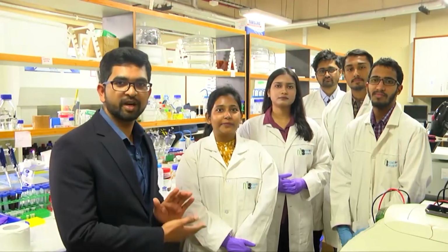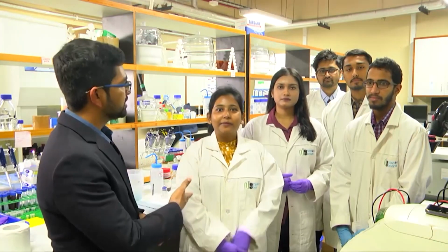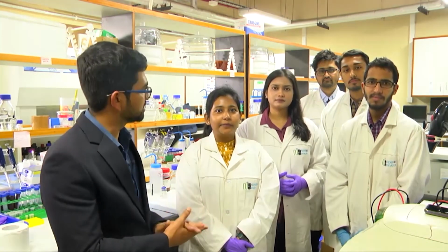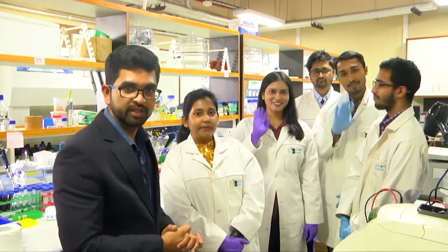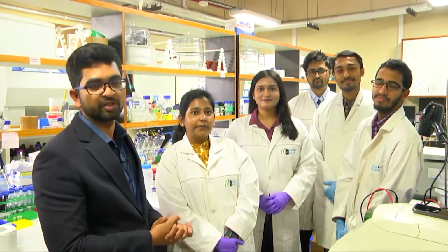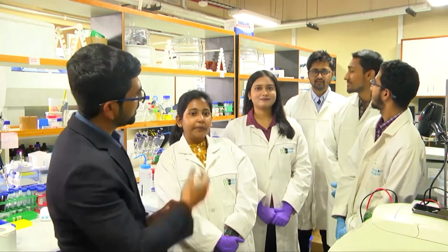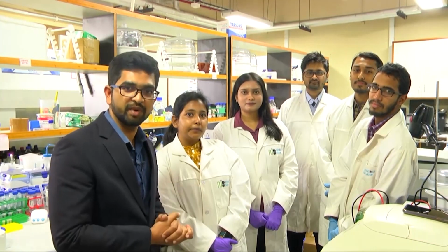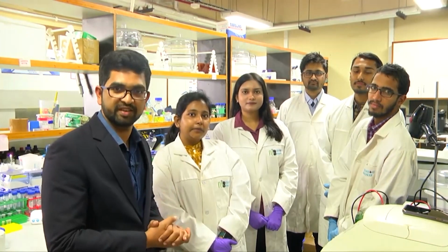Okay, let's introduce my TAs. So here are Srishti and Raghav, who are going to show you the very basic technology for the electrochemical characterizations. Here Mukti and Bimalendu are going to show you the synthesis of the nanoparticles and their applications for your electrochemical study. And here Jai is going to show you how to develop the portable potentiostat and the app development for the smartphone based device.